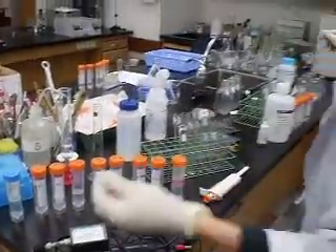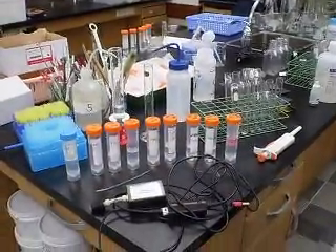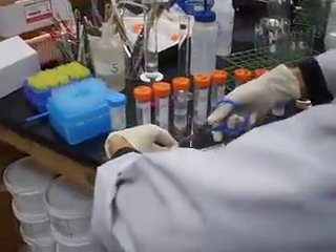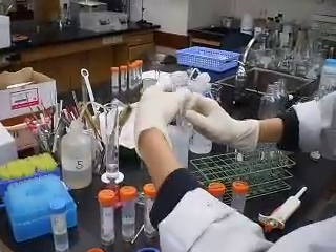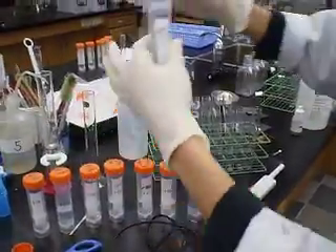So what I'm going to do is test this out first. I have a pair of scissors here. I'll cut it. The reaction between magnesium and hydrochloric acid will produce hydrogen gas. I have all my test tubes here.